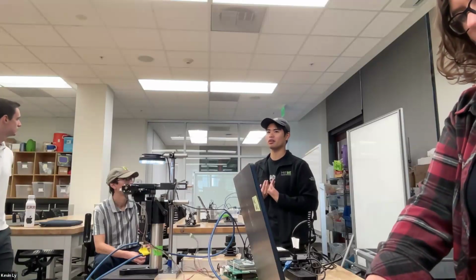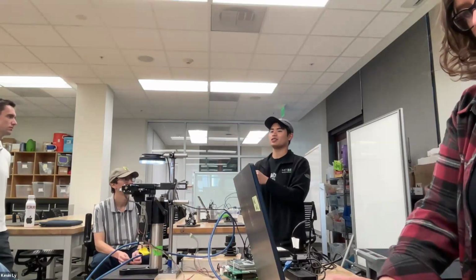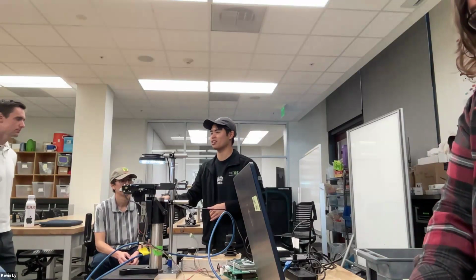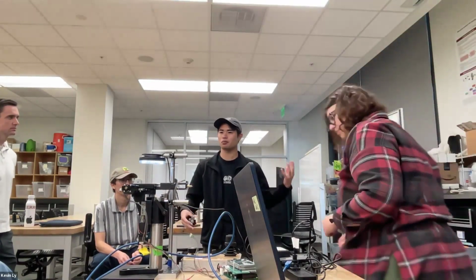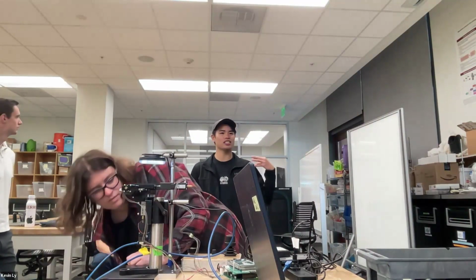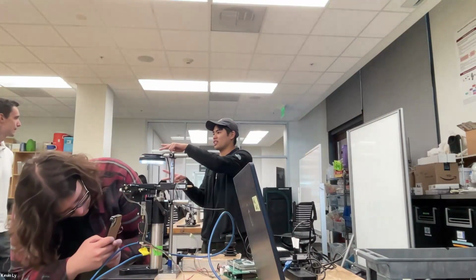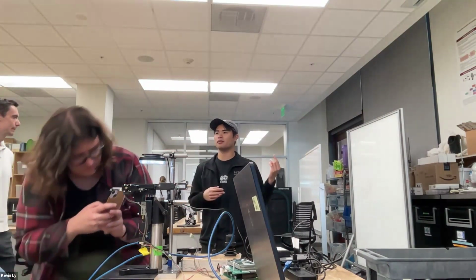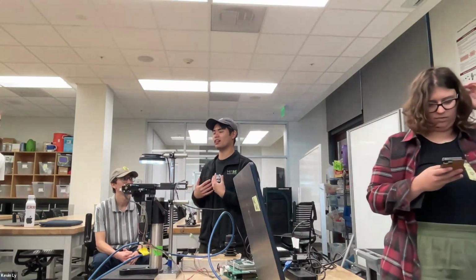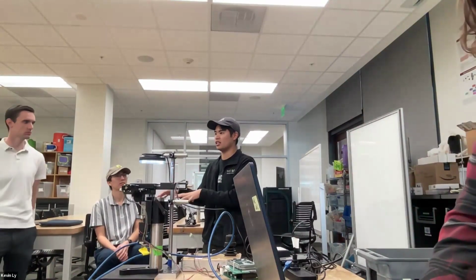What I want to do as a programmer is just say take one step. So a driver is that middle person who is very knowledgeable about the device, but knows what the programmer is talking about. The programmer says take one step, and the driver knows what that means: they want to do a sequence like this. And if the programmer says go faster, the driver knows it means it needs to change some other hardware settings.